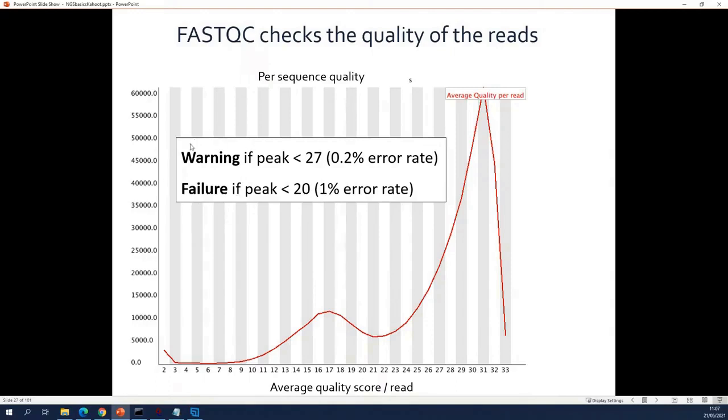Here again on the slides, you can see the rules that are built in for calling an orange exclamation mark or a red cross. When does it do it? When the peaks are lower, when the peak is below 27 or when the peak is below 20. What if you do see a clear set of reads with low average quality? You can remove them in the next step of the analysis. So there are tools that allow you to remove low quality reads from the FASTQ file.